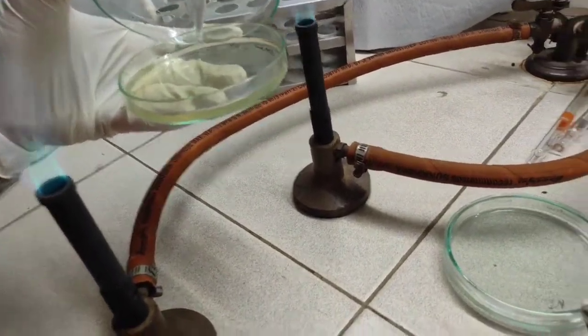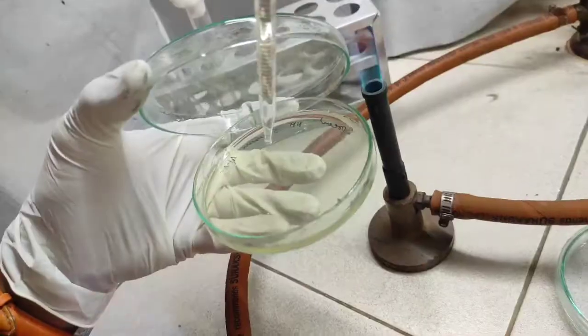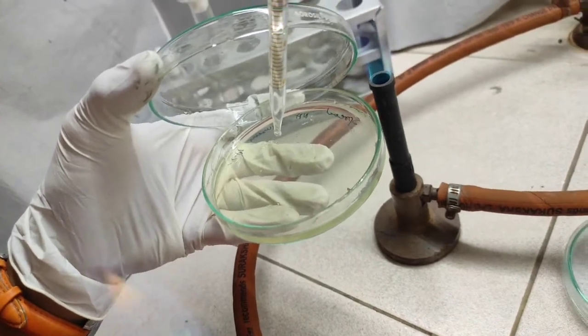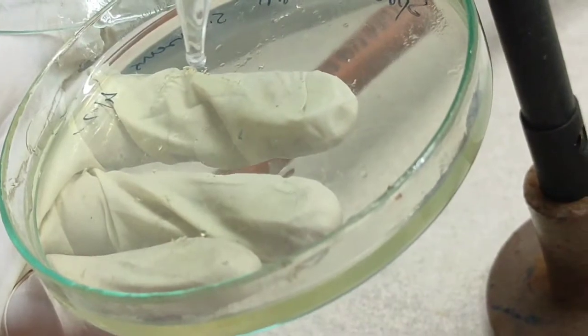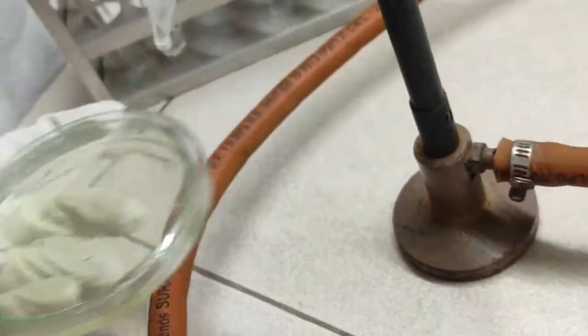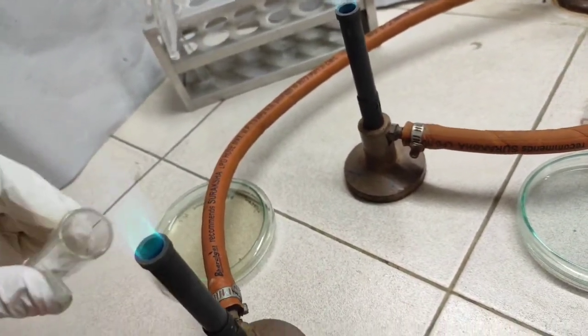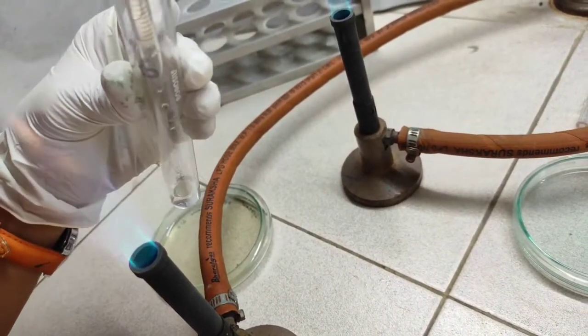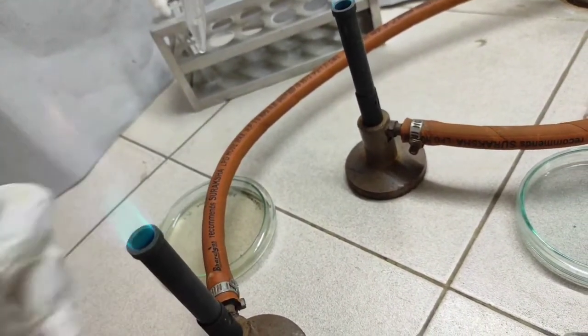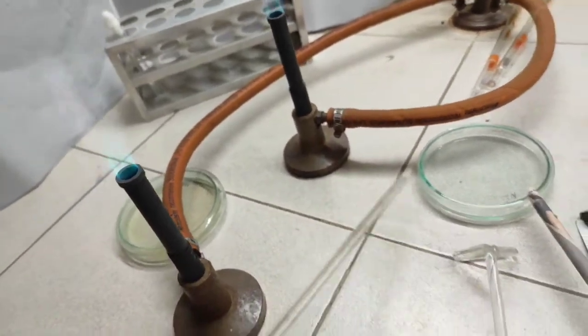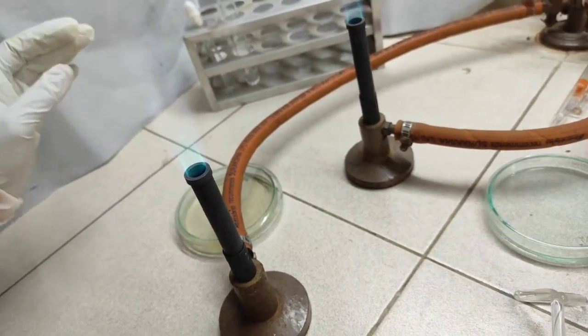Place it at the center of the plate. Place 0.1 ml of culture at the center of the plate. Place 0.1 ml of culture in different parts.